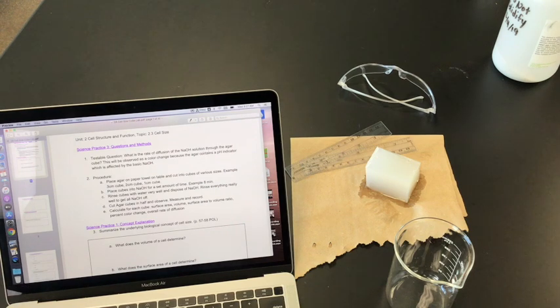What is the rate of diffusion? So how fast can sodium hydroxide move through the agar cube? Well what is an agar cube?